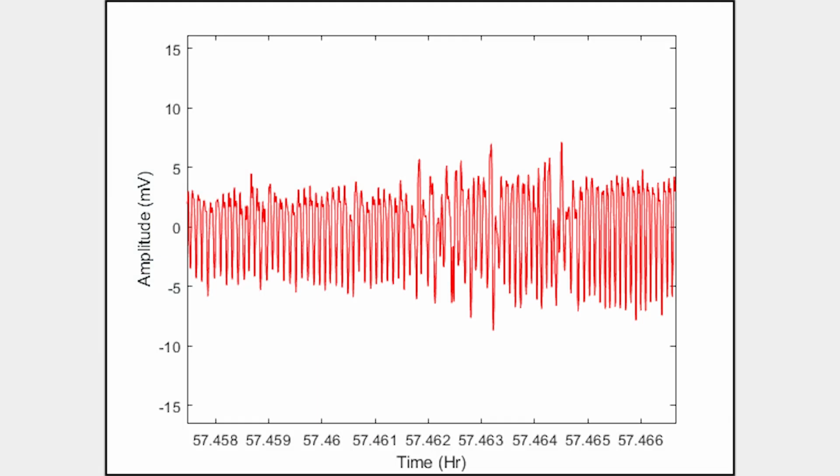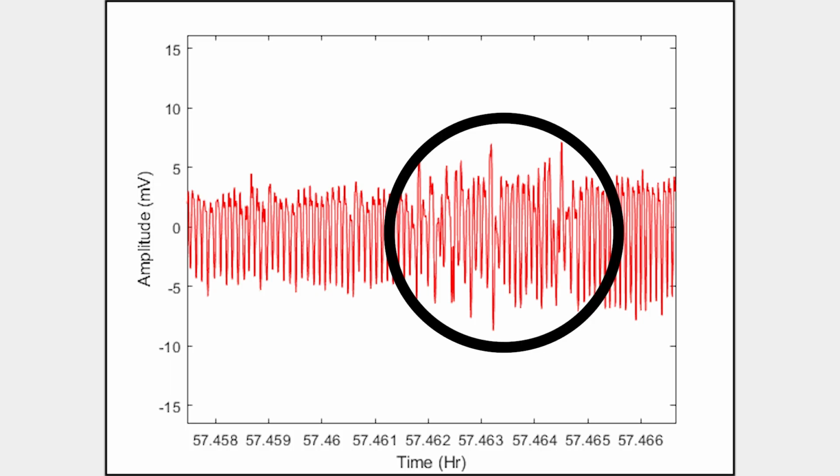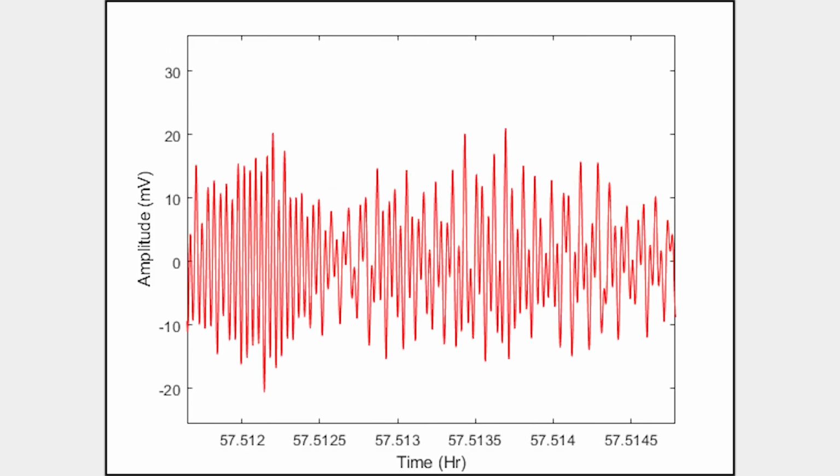If a breathing signal is consistently observed during periods of low activity, as shown here, that indicates good SNR. Note the rhythmic decreasing and increasing pressure from the thorax pressing on the cage floor, as well as some variations from small body movements or changes in respiration rates. If a strong interfering signal is present during respiration, as shown here, this can mask important changes in respiration and performance values may not be achieved.